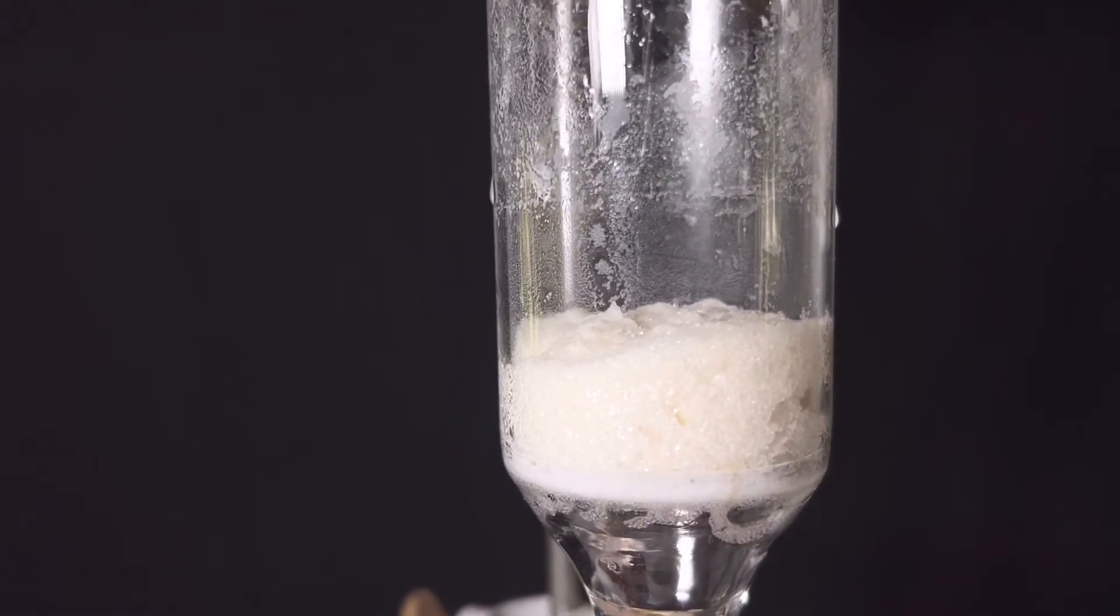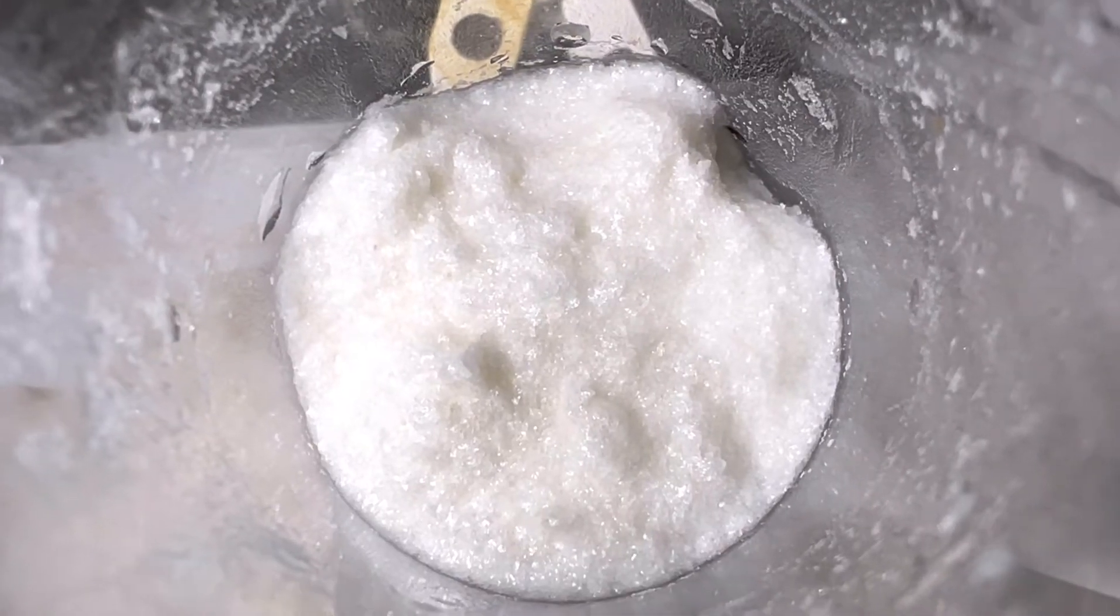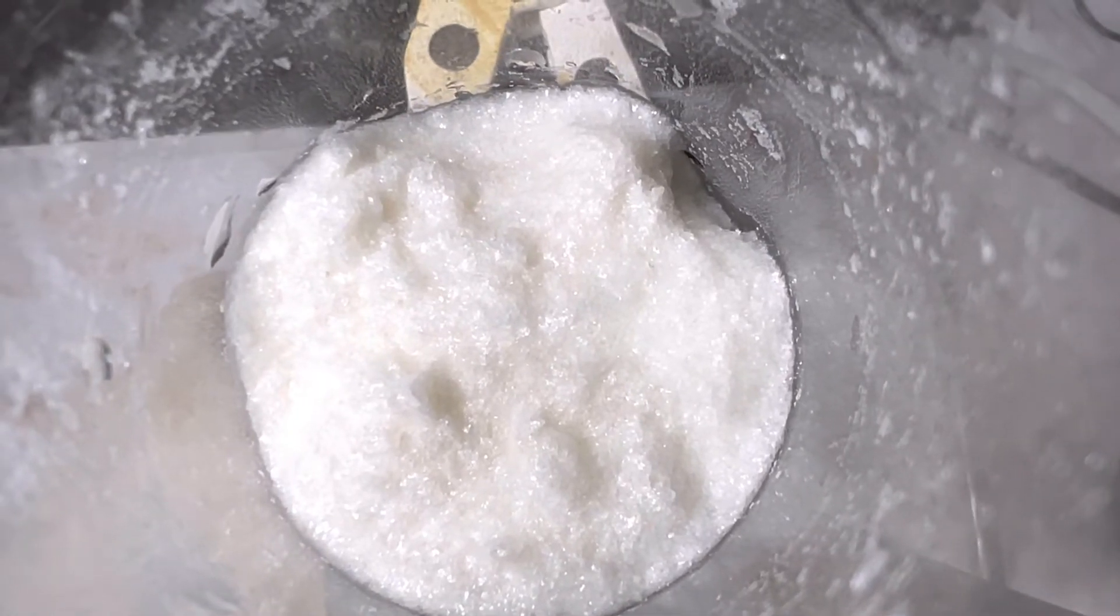This is the recrystallized pure product. It weighs 6.4 grams and it surprisingly coincides with the yield given in the literature.